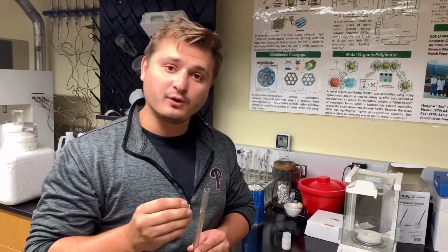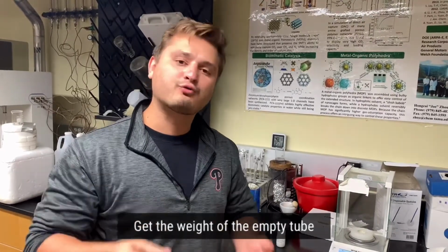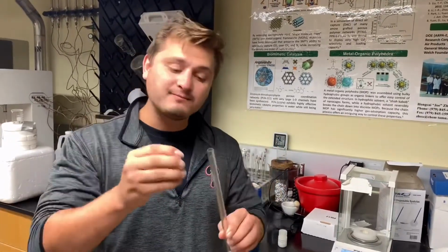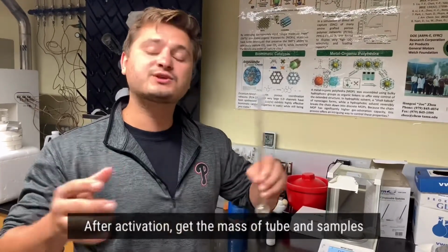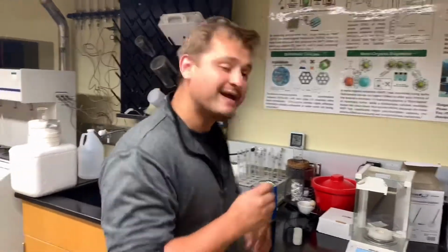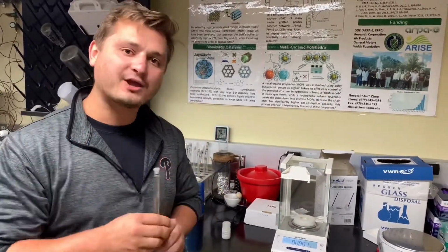In order to prepare a sample, we first need to get the weight of the empty tube. With all of these adsorptions, gas adsorption and vapor adsorption, these are per gram or mass-based metrics. So what that means is we need to know the exact amount of sample that we are using. We do that through a subtraction method. We first will get the weight of the empty, dry, clean tube, and then after activation, we will get the weight of the tube with the activated sample in it. We will subtract the two, and then we will get the weight of our sample mass. So in order to get this very accurately, as it is a per mass metric, we want to be very accurate with our mass calculations.